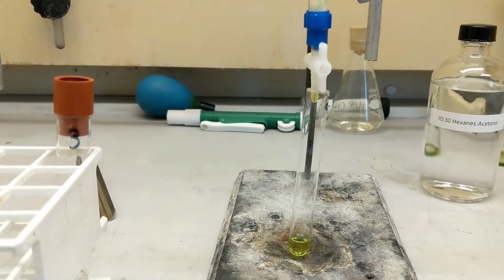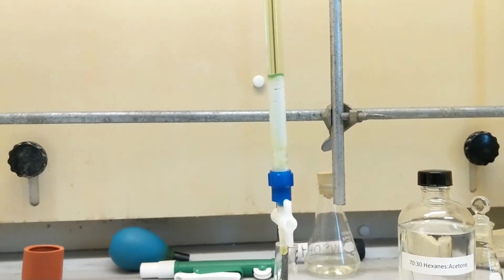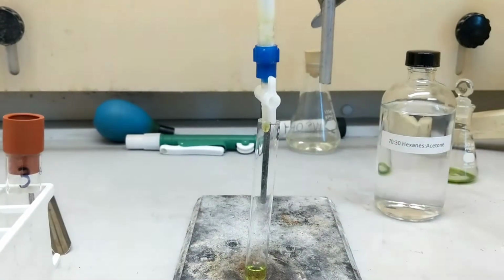turn it off, cap it up, switch to test tube 3, and I'm gonna try to get a green, but something tells me it'll turn out more blue. I don't know, maybe not, but we'll see. I also have to get rid of all that, so wish me luck.